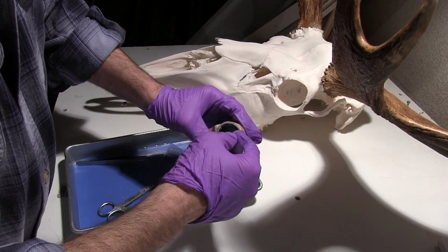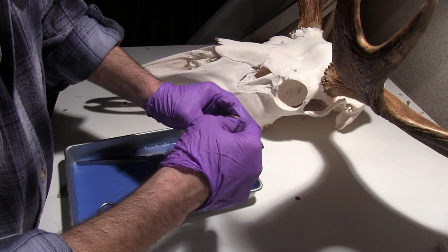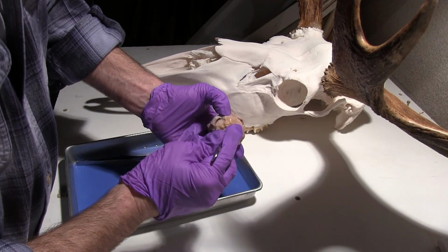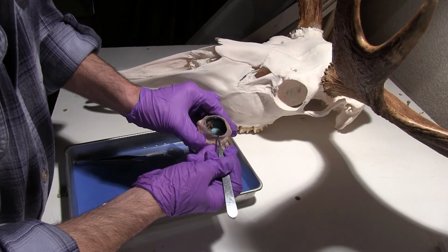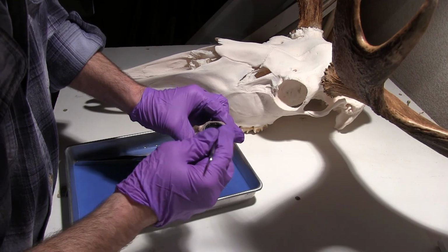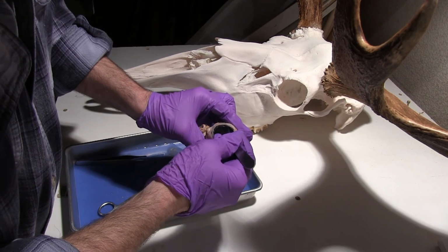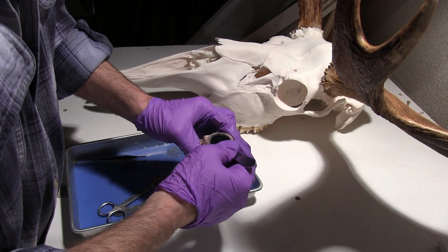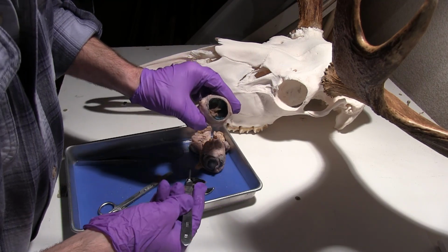And then again, right there, we're seeing where the optic disc would be. We can tell this connection here of this delicate white part of the retina, and there we are going to see the optic nerve coming off the posterior side. So going from the outer portion in, we have the sclera. Looking back here, the optic disc is right there. This is going to be part of the choroid coat, and that contains the tapetum lucidum right there. And then on top of there, we have what we think of as the delicate membrane that is going to be overlying that choroid coat.